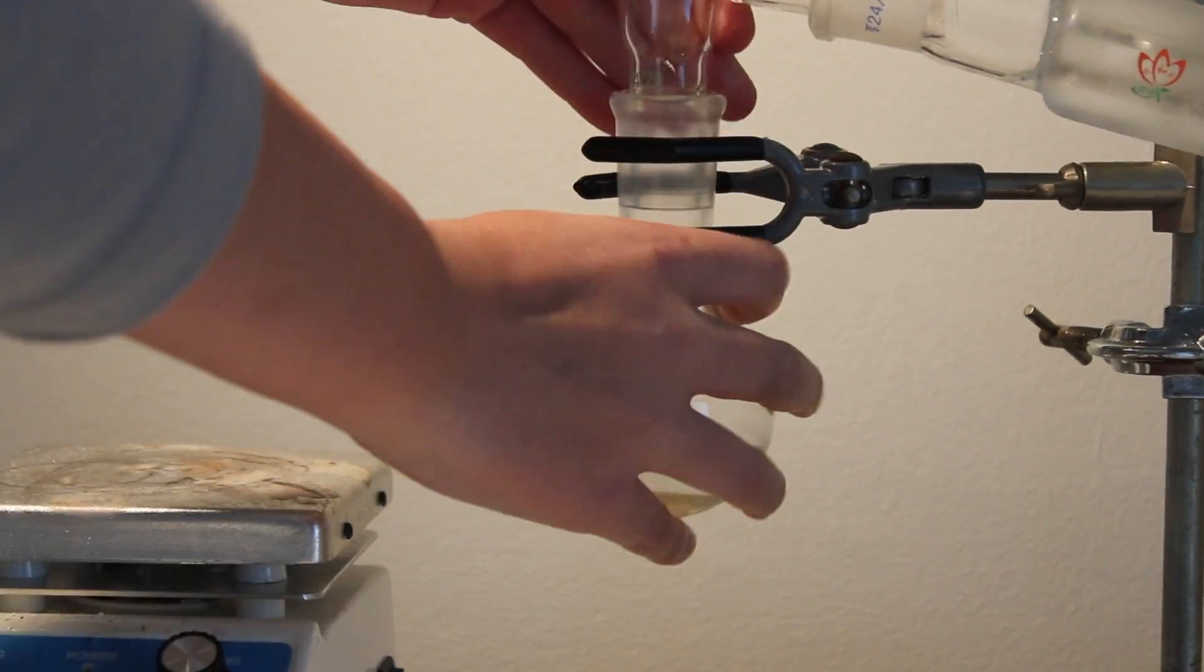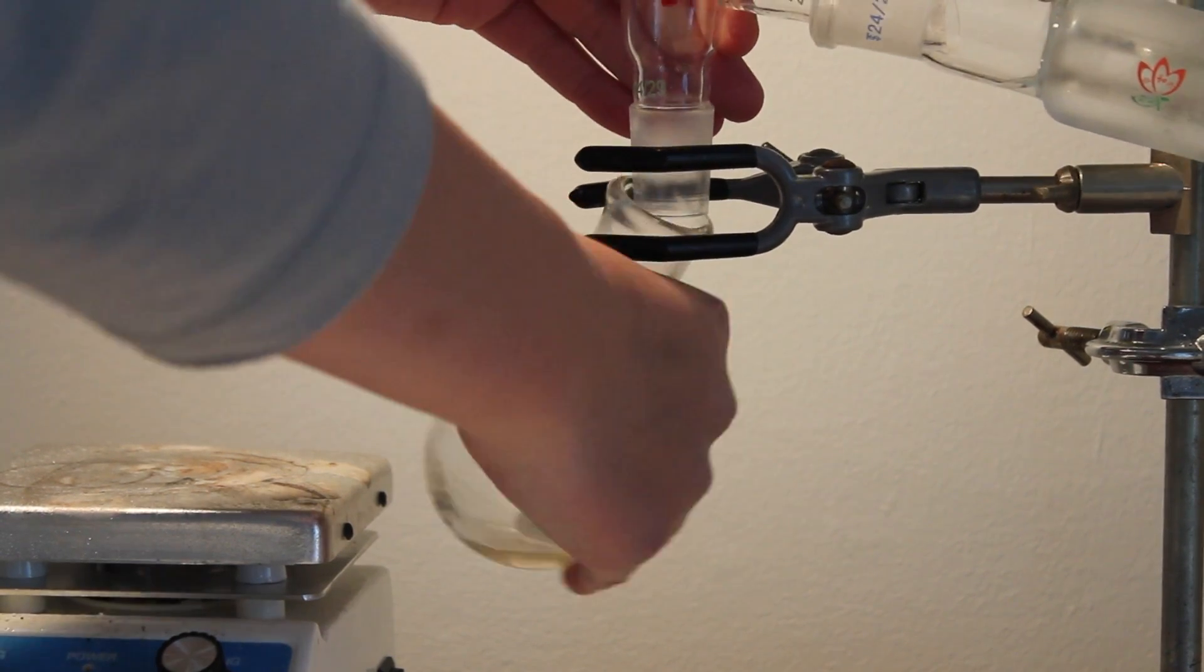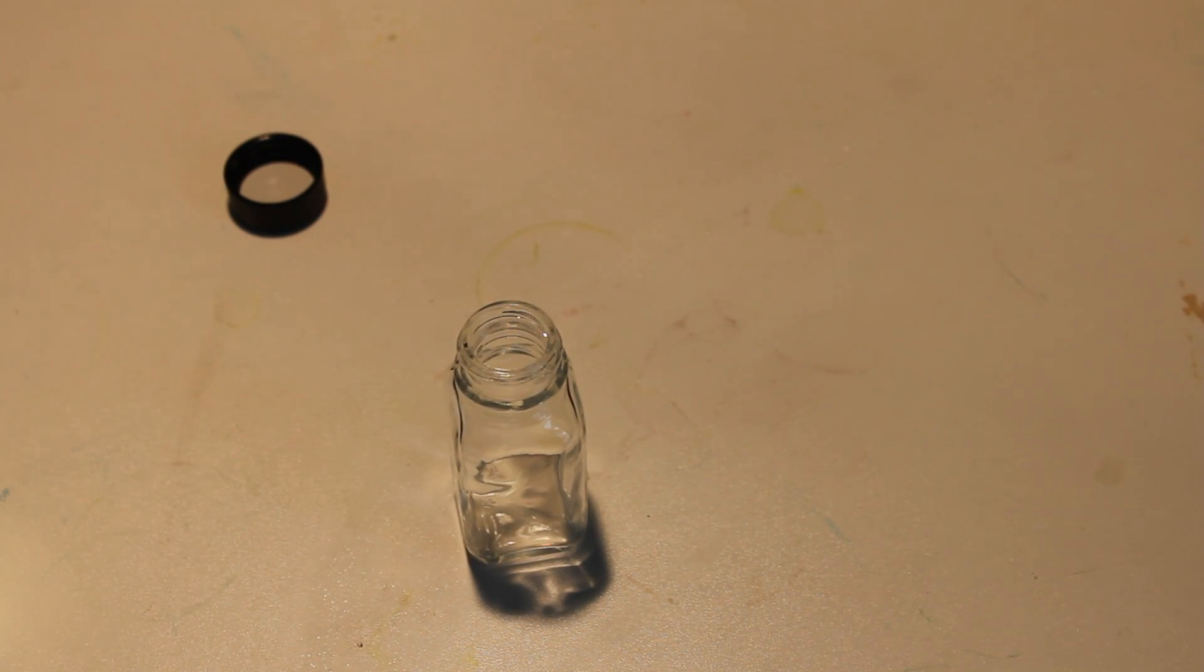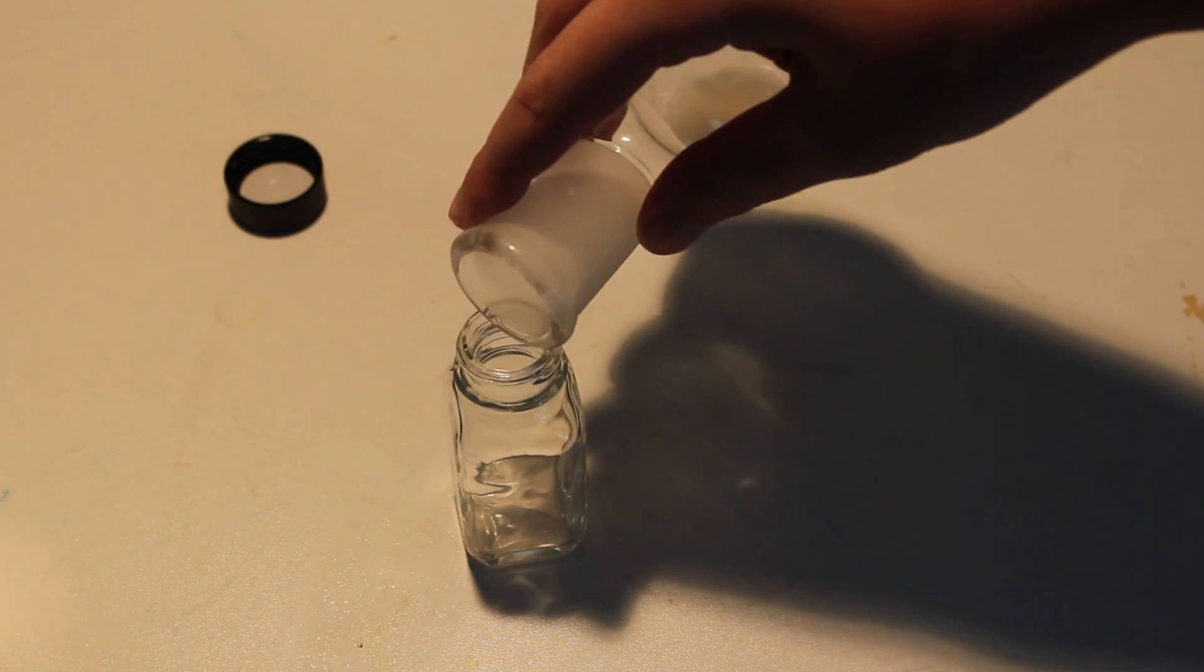Remove the hot plate to let the flask cool more quickly. When the liquid's cooled, transfer it into a container for storage.